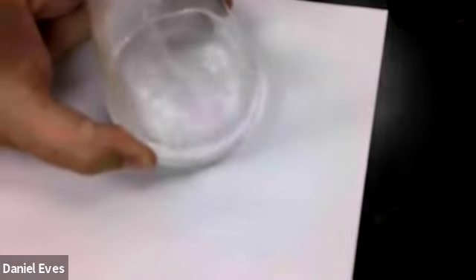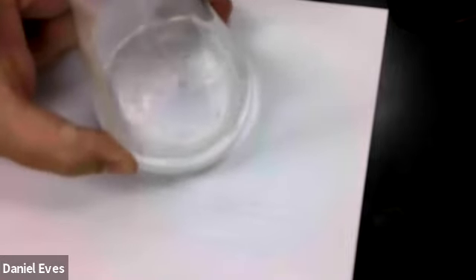Now we are using, again, 5 milliliters of acetic acid that's been diluted to 50 milliliters with water, and then we're adding our sodium hydroxide solution that we made at the beginning and waiting for it to turn pink so we know exactly how much acetic acid is in the vinegar. We're doing well. Still, the pink color is going away when we swirl it. Okay, we're getting close to 40, so we'll go ahead and slow that down now.